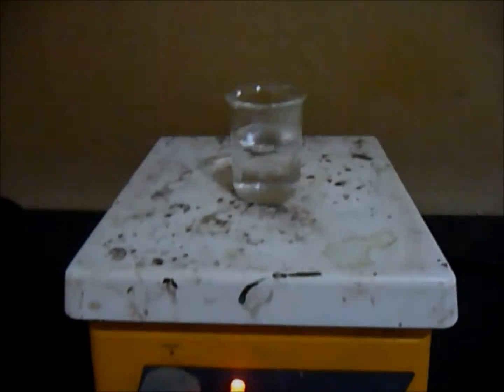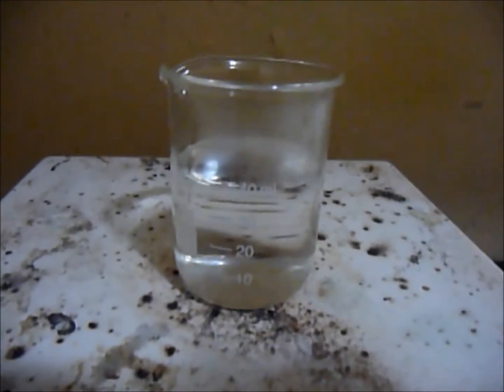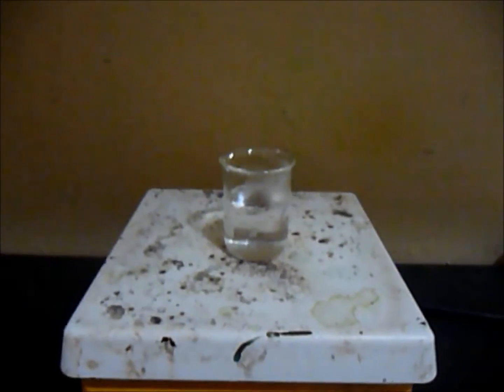Next, I'm going to boil about 30 milliliters of hot water. It's been about 10 minutes and you can see steam starting to come out, so that means it's about to boil. This is ready already.